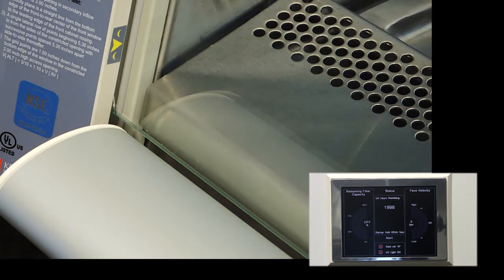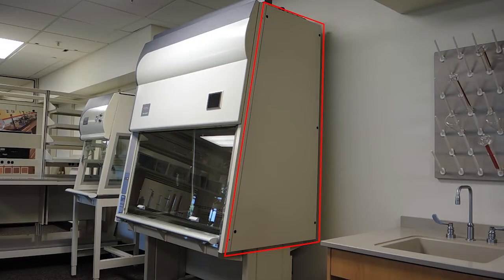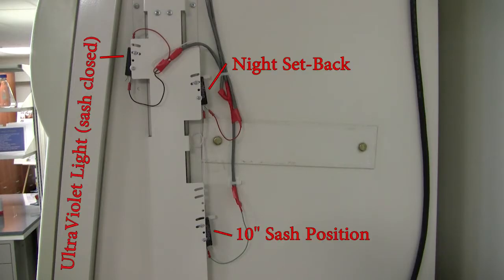If the BSC is sounding an alarm when the sash is at one of the formerly described positions, corrective action can first be taken by adjusting the micro switches located behind the highlighted panel on the right of the unit. This panel is held on by screws behind the button caps. Each of these can be adjusted to affect the alarms as labeled.